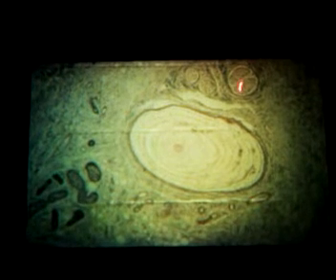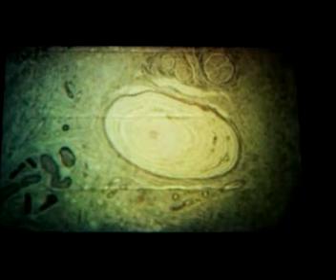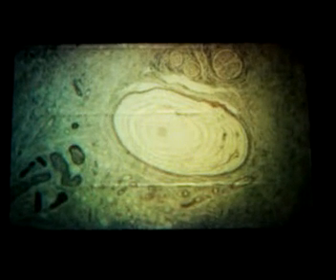This is actually a sweat gland over here, stained a little bit differently. And then up here you have nerves. There are the axons here, and here's the axons, here's the axons, and then you have a little bit of the connective tissue. You don't have the great big nerve like we showed before, but you have the smaller ones. This tells you you're pretty close to the periphery of the body, and this is actually in the dermis of the skin. Looking for Pacinian corpuscles, the dermis of the skin or the mesenteries is about the only place you're going to find them. They deal with pressure.